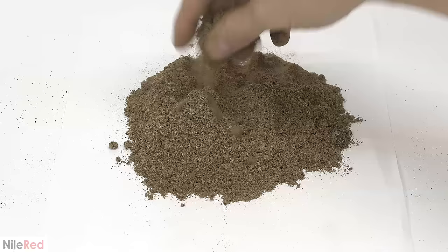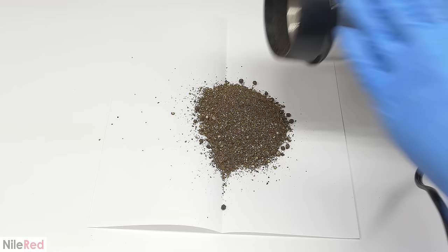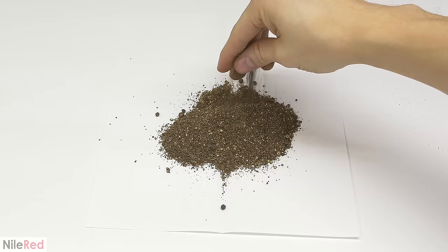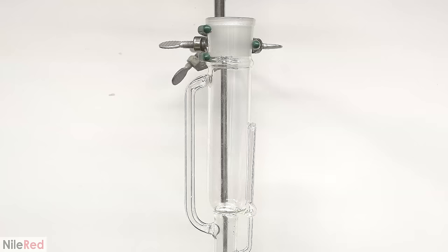I really thought I could get away with crushing it into a fine powder like you see here, but it ended up being a total failure. What you really want is something like this, which is being crushed, but it's still somewhat granular. I didn't do it, but before moving on, it might be a good idea to pass the powder through something like a strainer to get rid of the larger pieces.